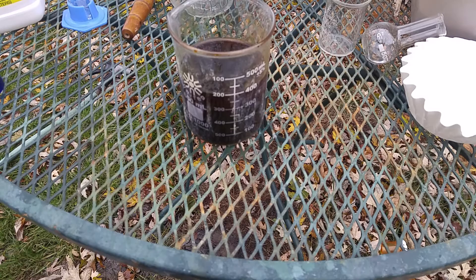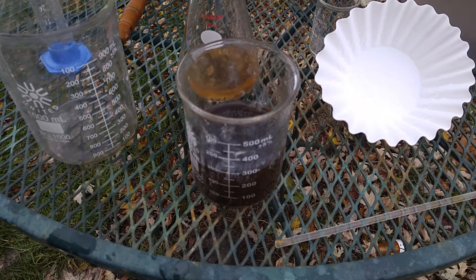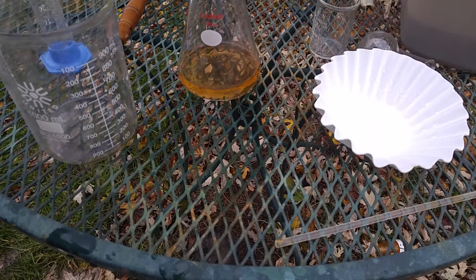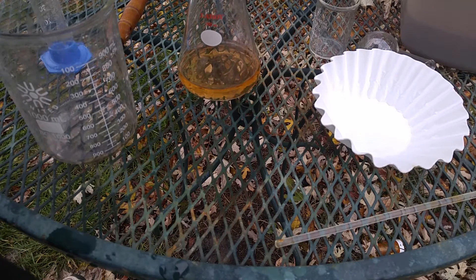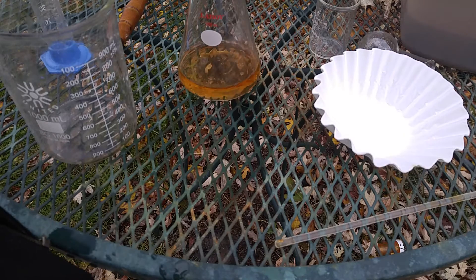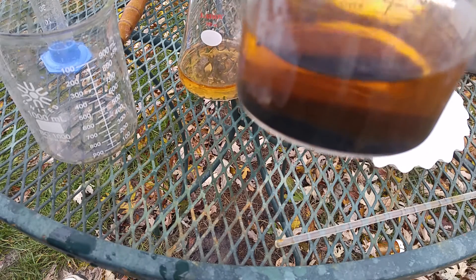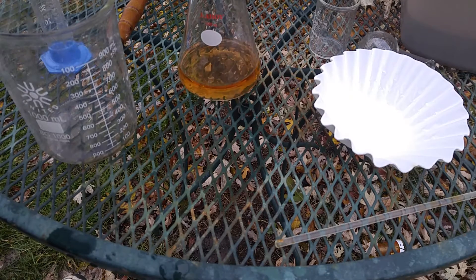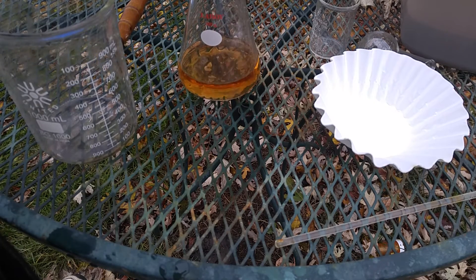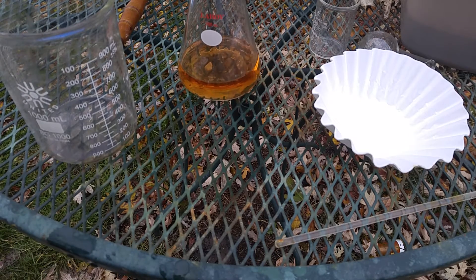Skip ahead to the fun part. After having washed the iodine thoroughly, I am now beginning to filter it off. As this is gravity filtration, this will take a while. As you can see, iodine, being as heavy as it is, is already collected at the bottom. This stuff is boring so I will wait it out.